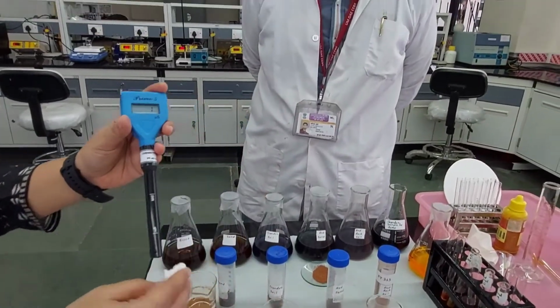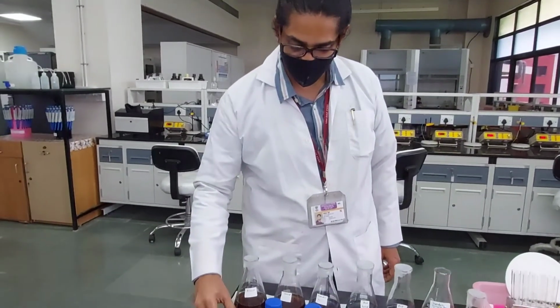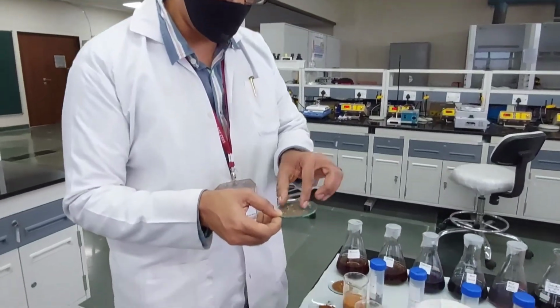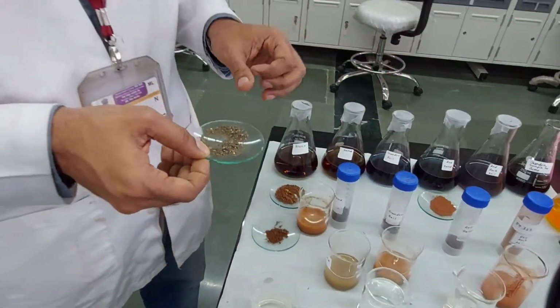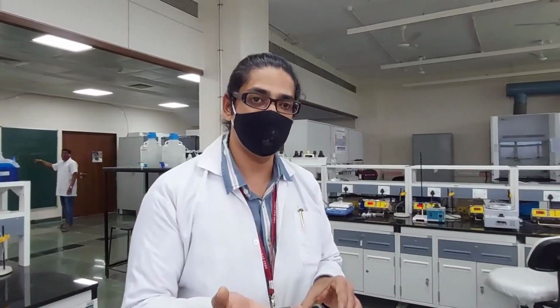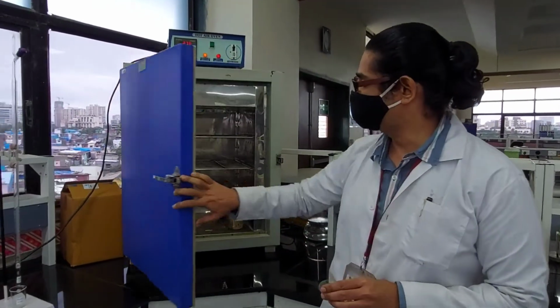So we had also measured the conductivity. Now, for the moisture content, what do we do? The samples you are seeing over here are already dry. Can you feel it? It's very dry. What we had done for the moisture content is a very simple thing. We took the soil as we had collected it, and it's monsoon season, so it was nice and drenched already. And we kept it in this oven.